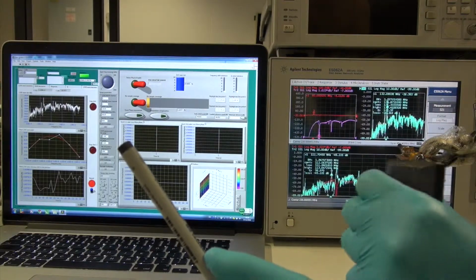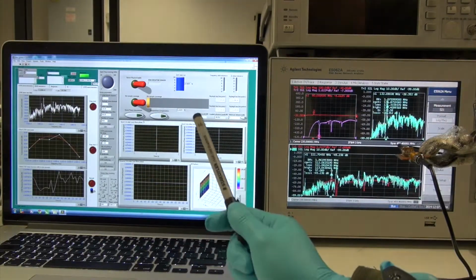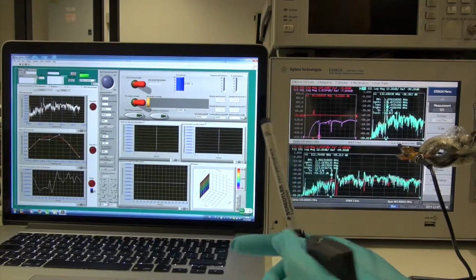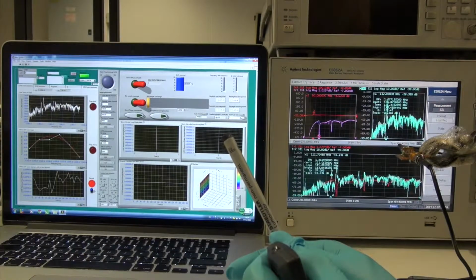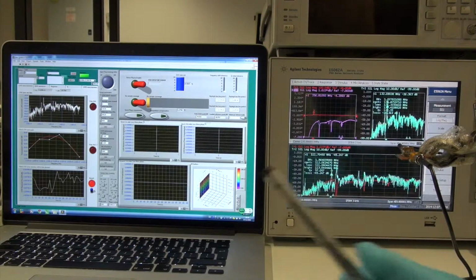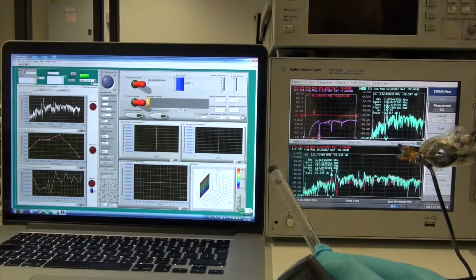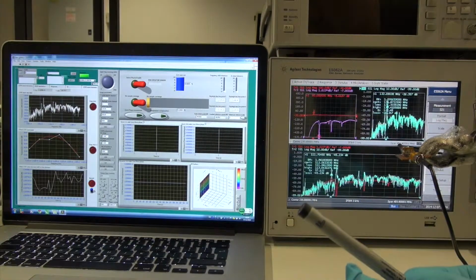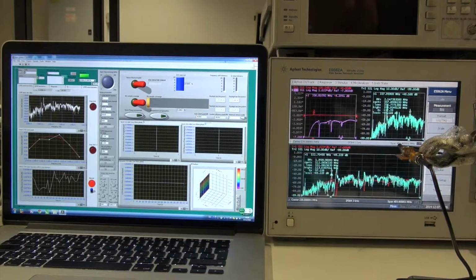This switch controls the device surface coverage analysis. I want to highlight this one because it's related to a very important feature of our device. We have both Rayleigh wave and Love wave resonance in the same device. We use the Love wave as the main measurement signal, and the Rayleigh wave for the surface coverage, because the Rayleigh wave is very sensitive to liquid contact. The energy will attenuate very quickly with surface liquid contact. So by calculating the amplitude of the Rayleigh wave resonance, we can know how much of the surface has been covered by the liquid. I will do a real demonstration here.